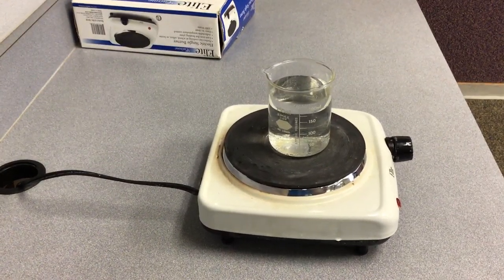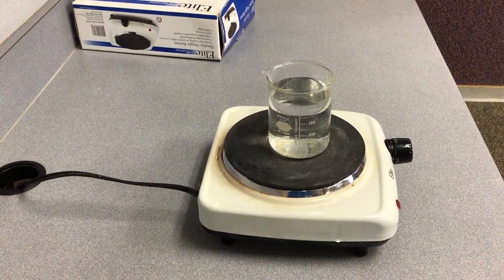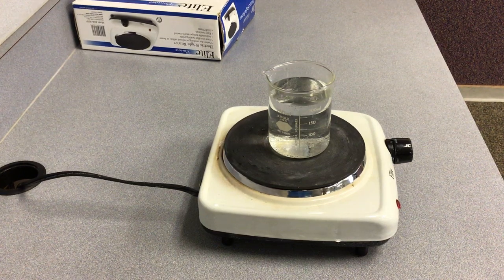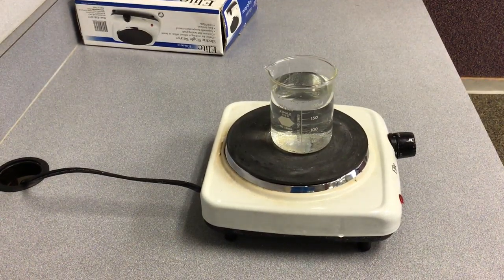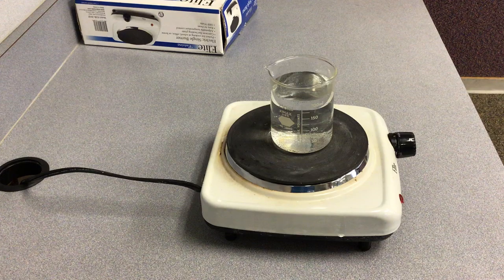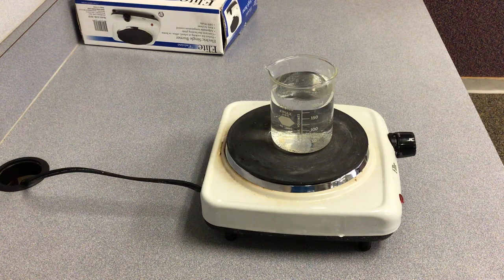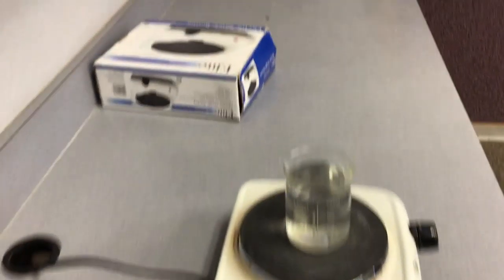Okay, here is experiment one, the water in the beaker. You're going to record the physical state of the water and its color, and then you're going to just see what's happening to the water.